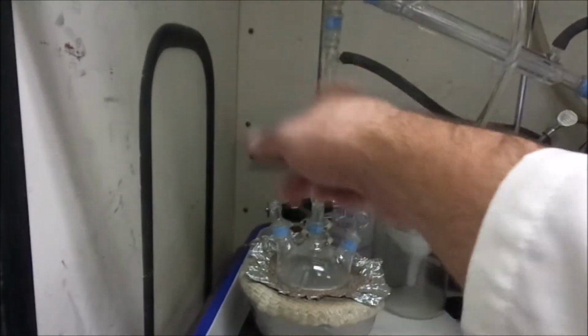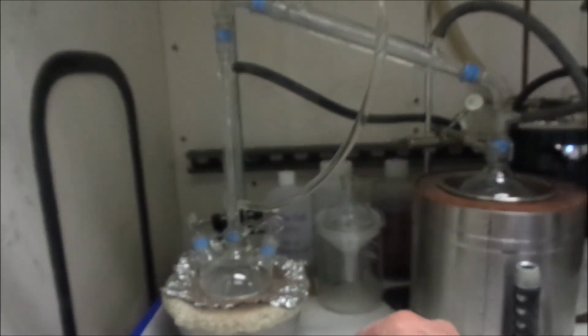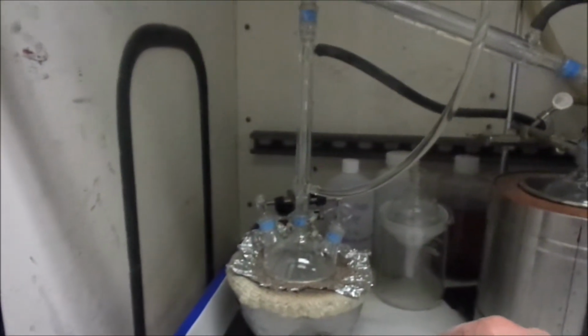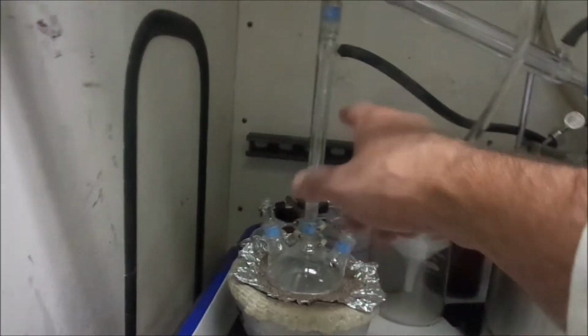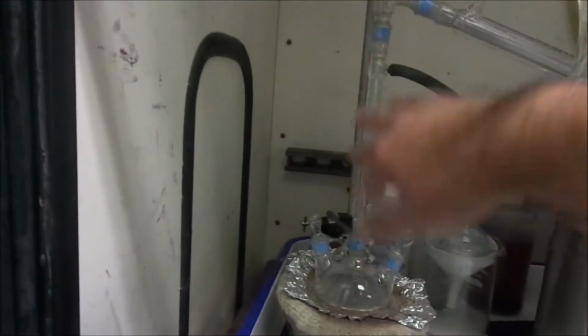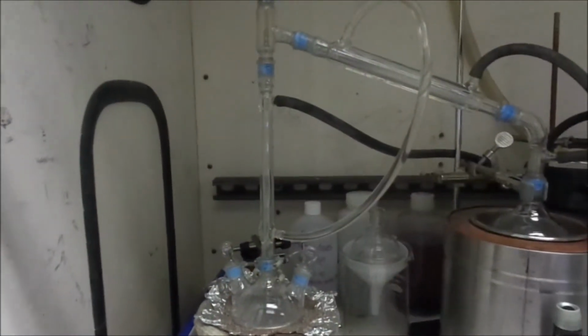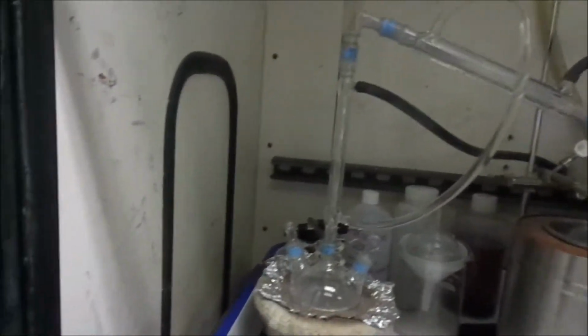Maybe what I could do is rig up a fan or something on this thing just to help keep the glass a little bit cooler, because we do have some fans laying around. So I think I might try and do that. But right now I'm going to get this hose off and just turn the temperature down and let the thing run without any coolant going through, so it's not dripping so much mercury back inside the chamber. And we'll see how that works.